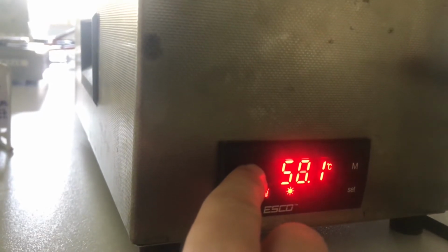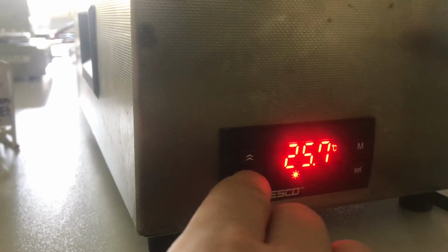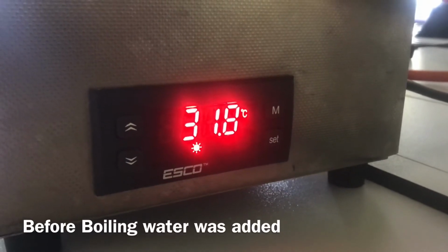When heating up, the trick is to add a bit of boiling water to the tub so it can evenly distribute and boost the temperature. I added just a bit and my temperature jumped up by almost 20 degrees.